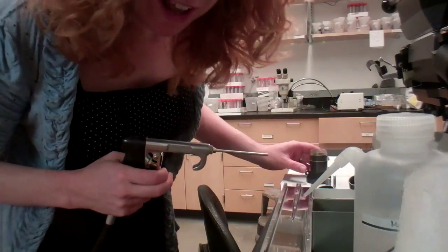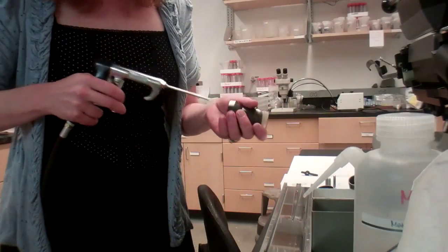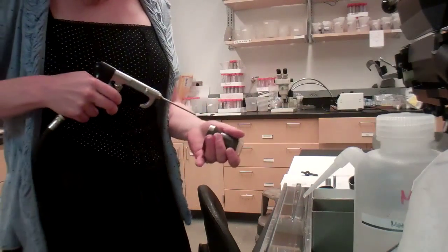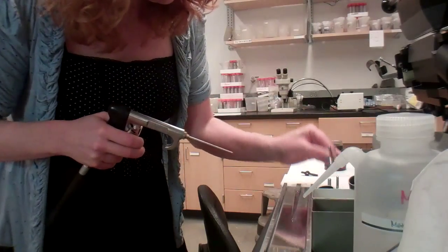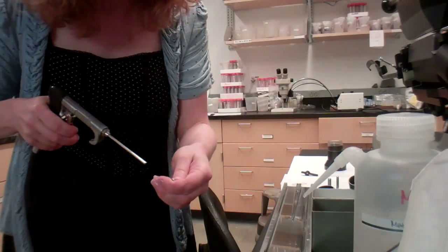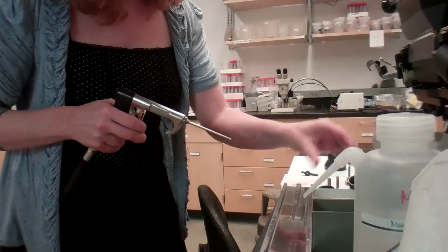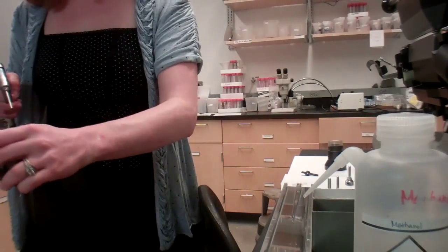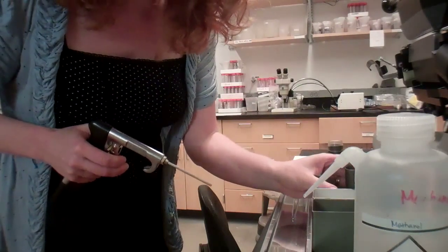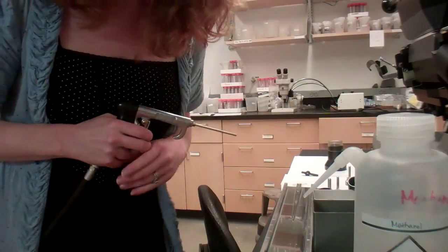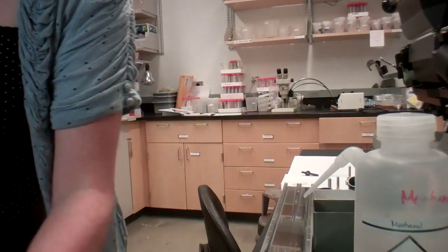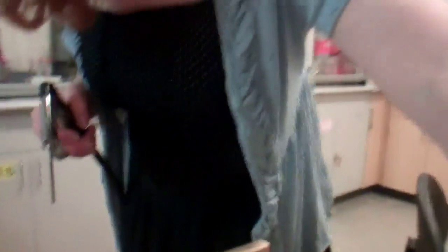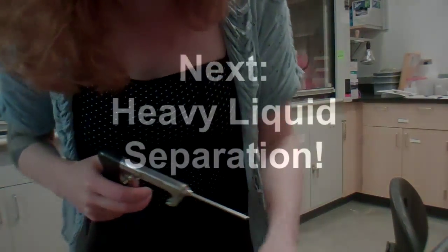Air gun. It's very powerful actually. You have to be careful. And now I air gun out every piece. Even little screws. It's actually kind of loud. Once I'm done air gunning everything, I'll put it in this little drawer where the Franz parts go. And then Franz will be ready to go for his next customer.